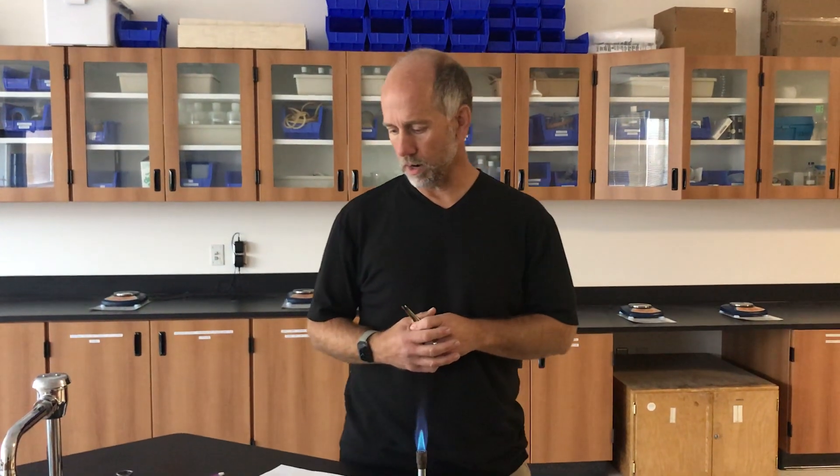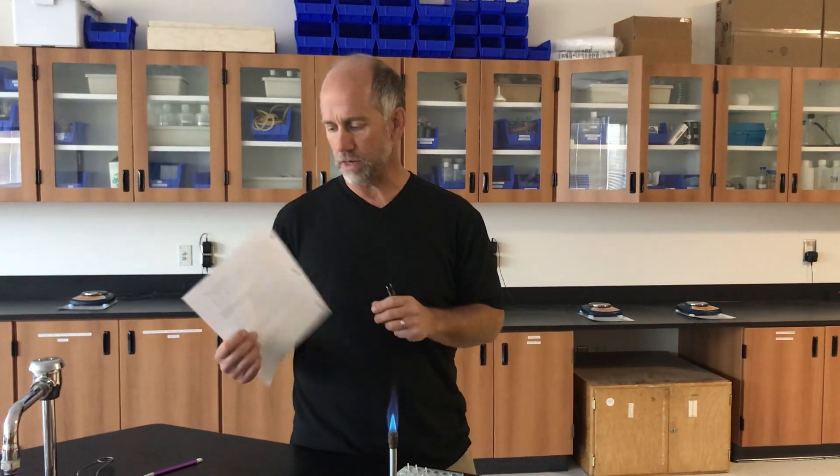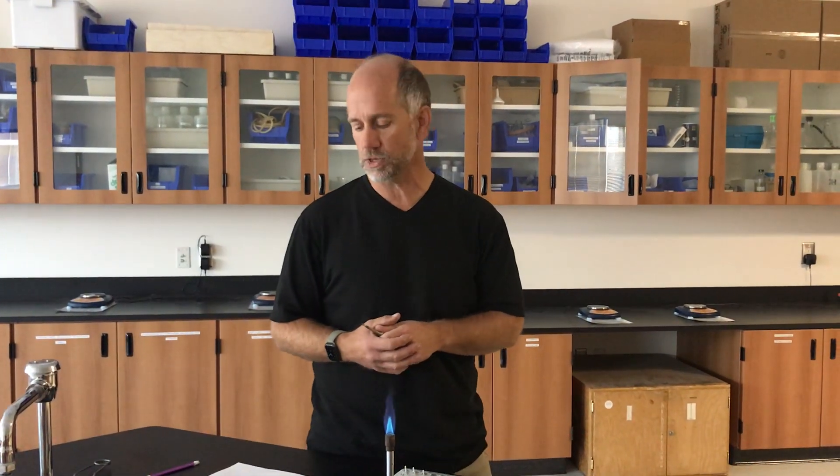Welcome to our video of us doing the flame test lab together. Hopefully, before you watch this video, you've already watched the pre-lab, so you understand the theory and the chemistry behind what you're going to experience today in lab. You should also have printed the lab handout. It is double-sided, and you'll need the front and the back to record your data. Please pause the video and print both pages of the lab if you haven't done so yet.